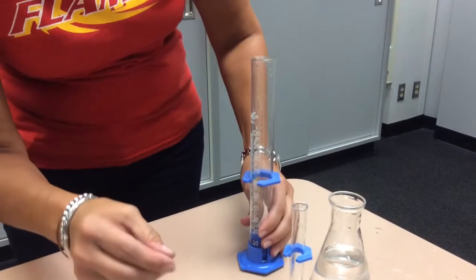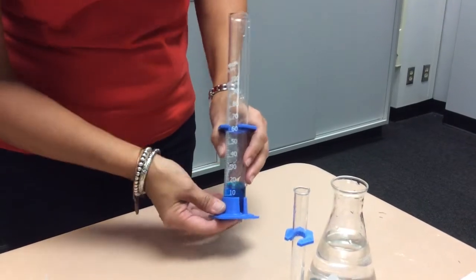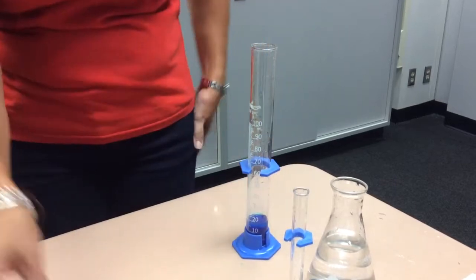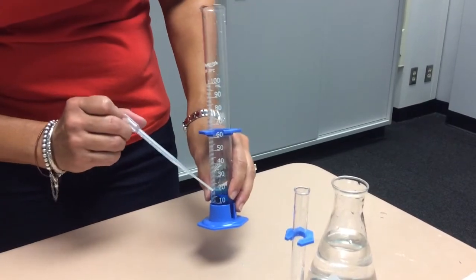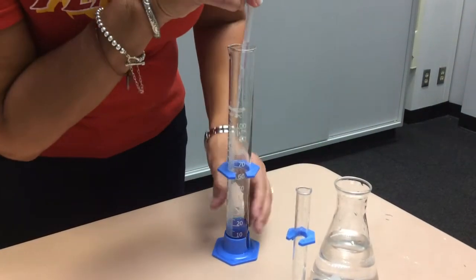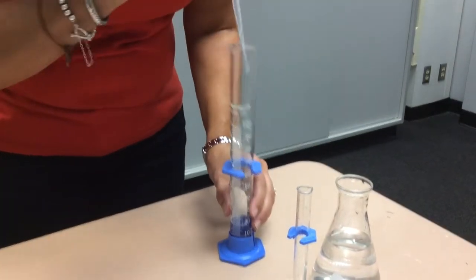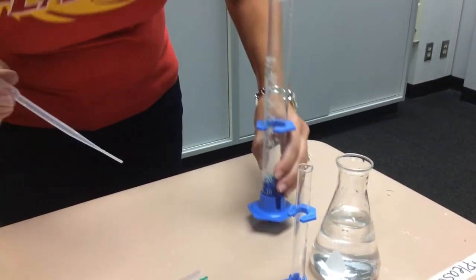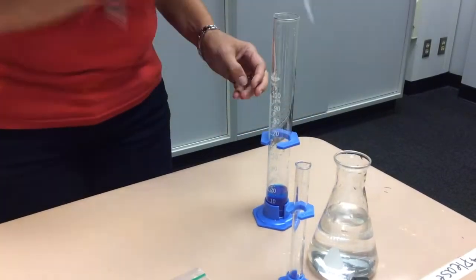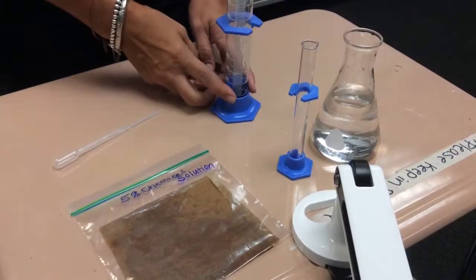And now I have 20 mils of a 5%, I've just made a 5% concentrated chemical solution by adding 10 mils. And actually you need to add a little bit more. So if you need to add a little bit more water, you can just use your pipette to get that up to 20 mils. And then we'll give it a little swirl to make sure it's completely mixed. A little bit more. There we go. So swirl that around. And remember, I only need 10 mils of this.